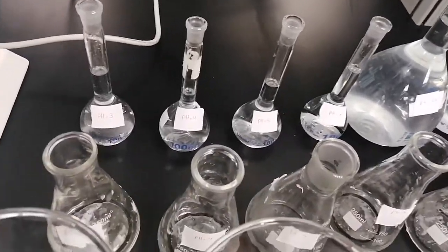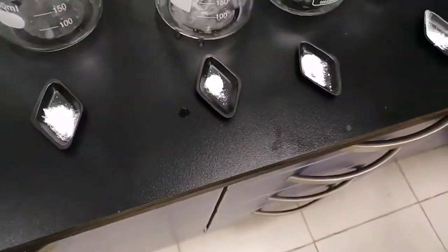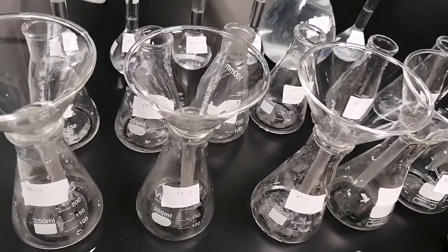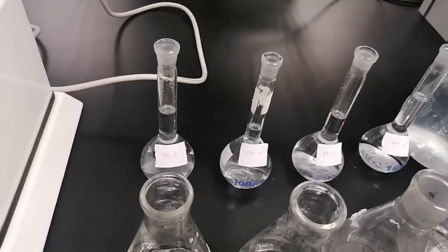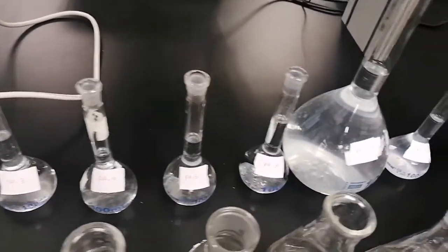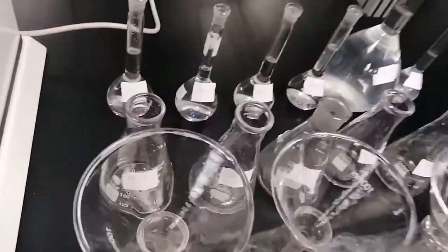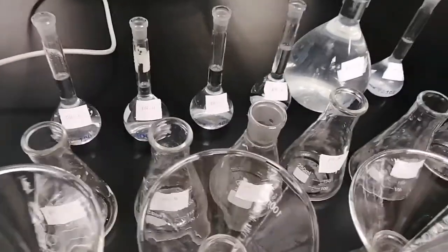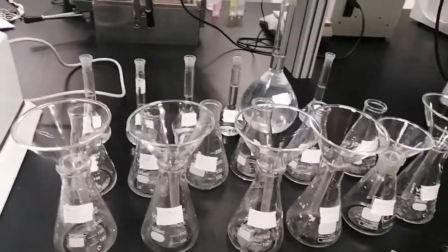Then we will shake for 15 minutes to dissolve almost every particle of the mefenamic acid samples we have. Then we will filtrate them in order to get rid of any excipients and measure the absorbance of them. So we will measure 50 ml of pH 3, 4, 5, 6, 7.4 and 8.2. Then we will fill them in an Erlenmeyer flask to prepare them for shaking. Then we will shake them for 15 minutes and then follow with filtration. This is the setup for the first part of the experiment.